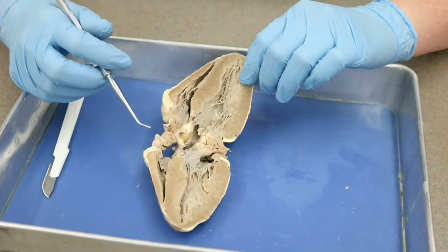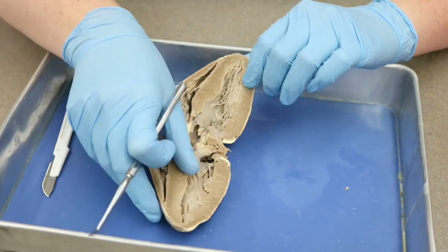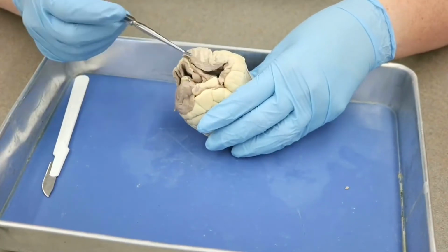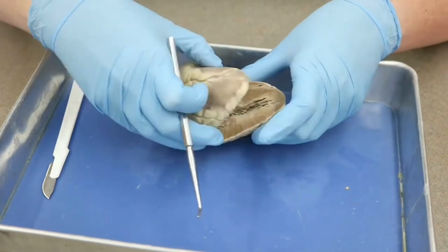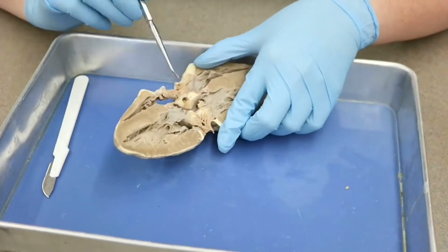Now, the last term that we haven't mentioned is our pectinate muscles. So I'm going to go ahead and close up our sheep heart here. And remember, we had our auricles here, and we said the auricles were adjacent to each of the atria. Well, when we open it up, we actually see inside of the auricles here.